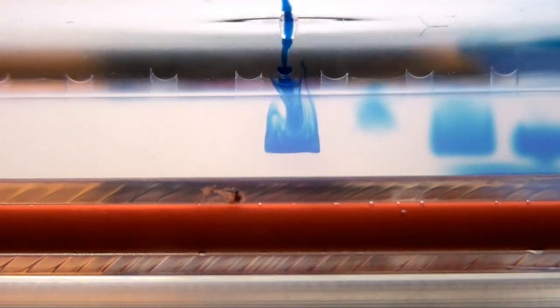Here is a quick example of what happens when you don't put your tip into the well. As you can see, the weighting agent weighs your material down into the well, but periodically you will see samples spilling onto the surface. This is usually not a huge deal, but it can contaminate local wells, which could lead to false readings. Just be aware of where your tip is and try to put it a little bit into the well to ensure proper loading.